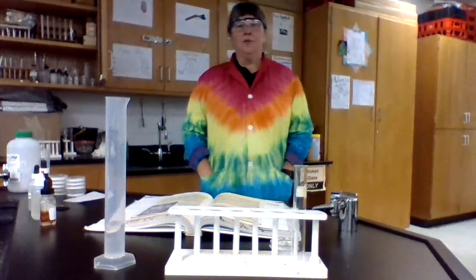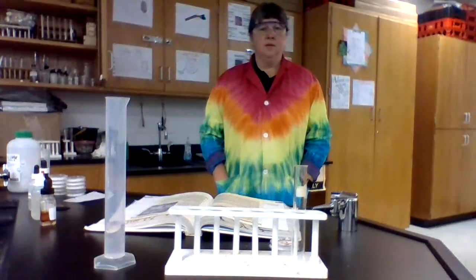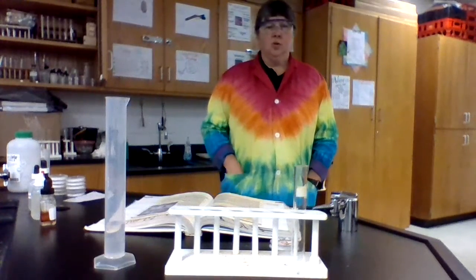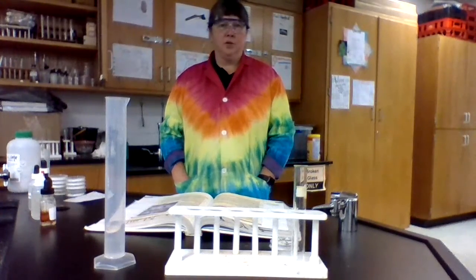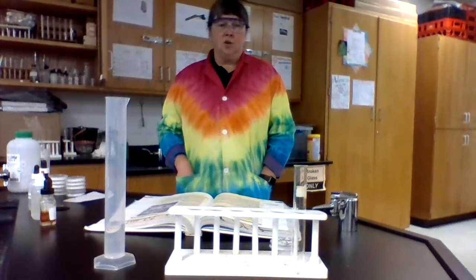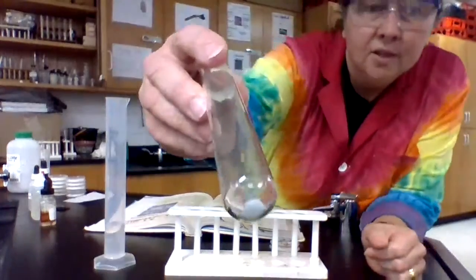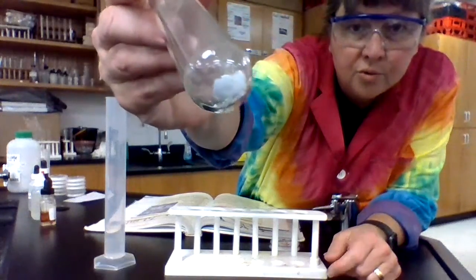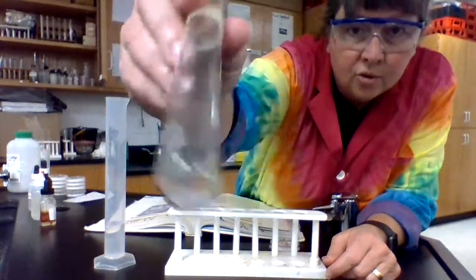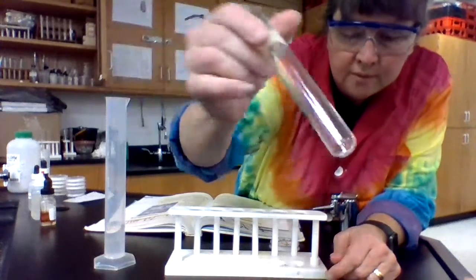All right, so now for the last part of labs 9.3 and 9.4, this is the unknown. The microscope view was taken, we took a picture of that the other day, so you should be able to look that up. This is what the unknown looks like in the test tube. So this is unknown number 1. Each lab group will get a different unknown, but you guys will have unknown number 1.